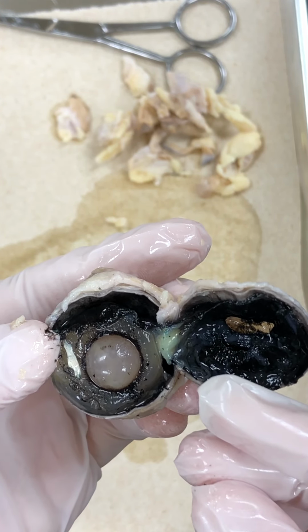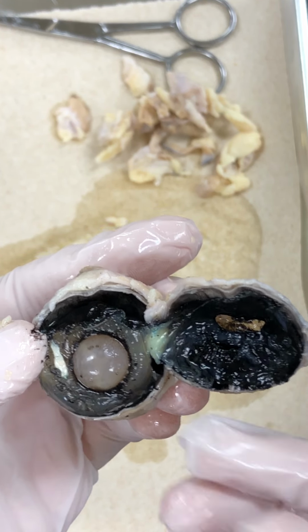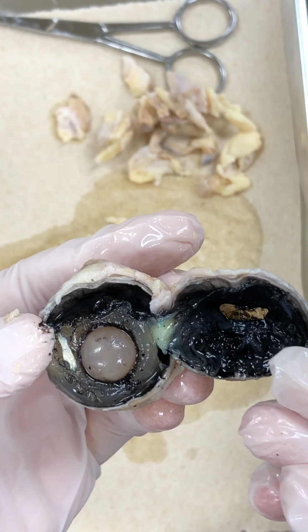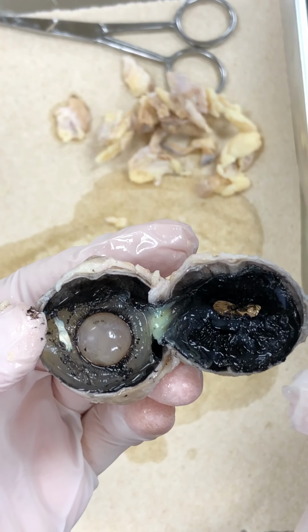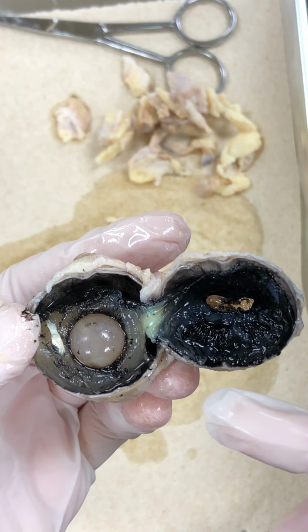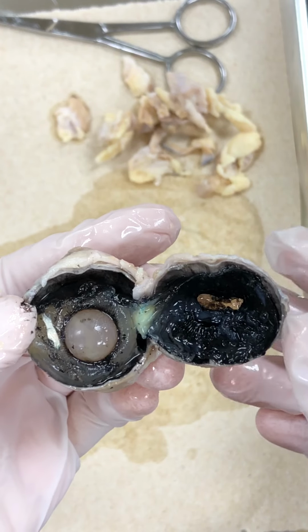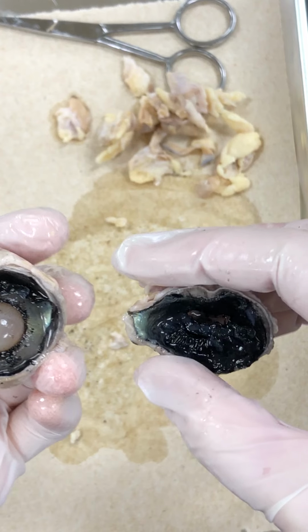There is a little bit of give to it because the ciliary muscles or the ciliary bodies, those are muscles, smooth muscle, are going to pull and twist and turn that lens to refract light just so that it can hit the retina the way it's supposed to based on how close or far away the image is. Let's see if I can get this to completely separate.